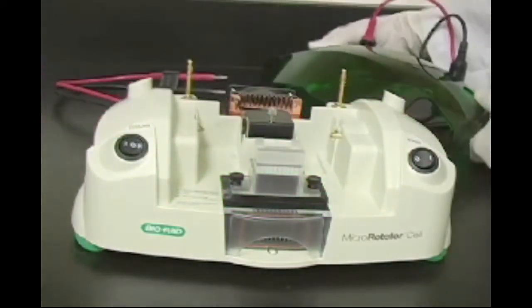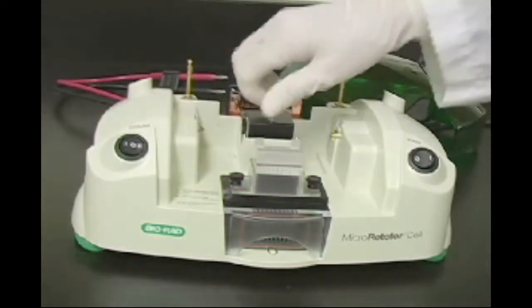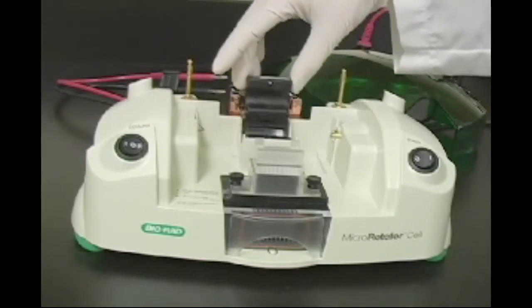When ready for focusing, turn the power switch off and open the cooling block cover by unscrewing the block screw.